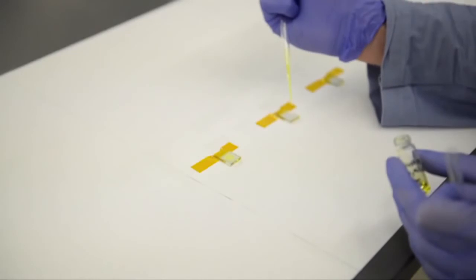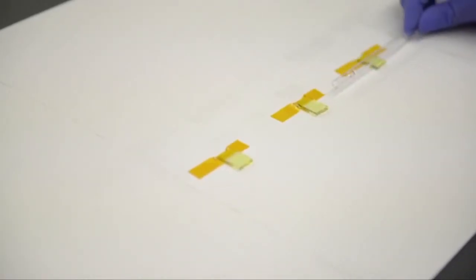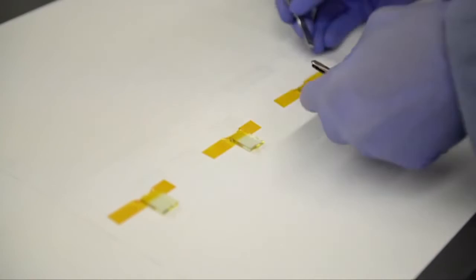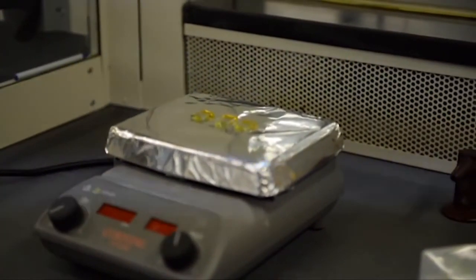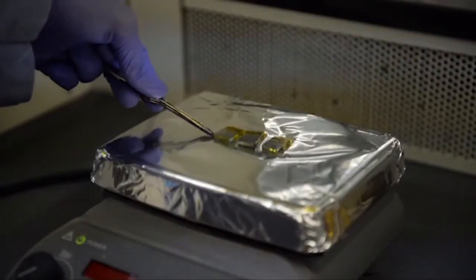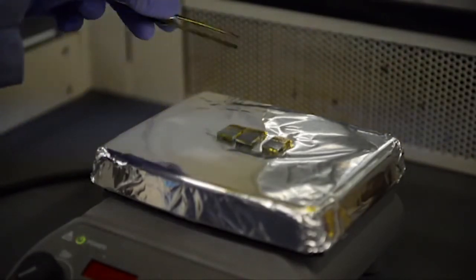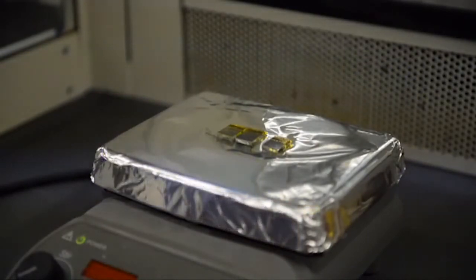We put 1 drop of perovskite solution and spread it across the surface with a pipette. We roll the pipette over the glass several times to create a uniform, smooth film. We keep the uncoated surface covered and remove the excess tape. We place the glass piece on a hot plate preheated to about 110 degrees Celsius. We wait until the film turns completely black and let it sit there for another 10 minutes.